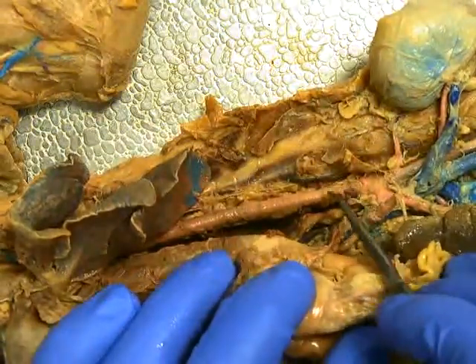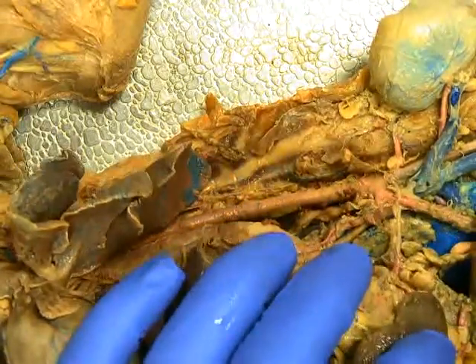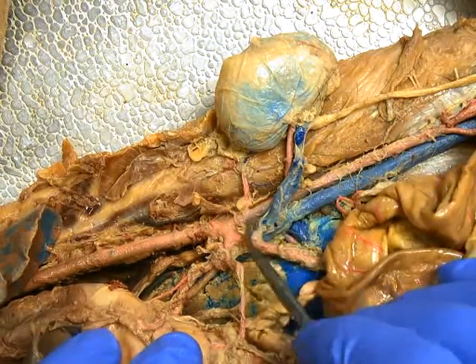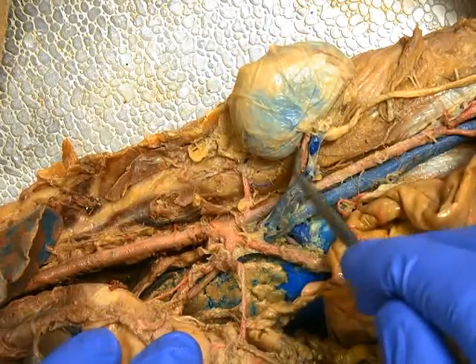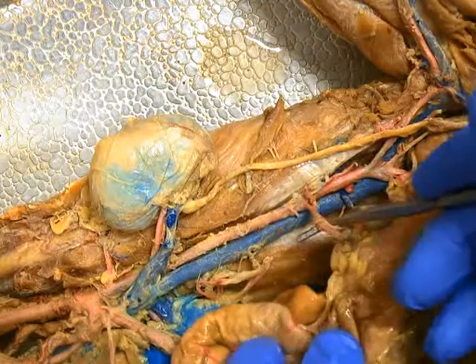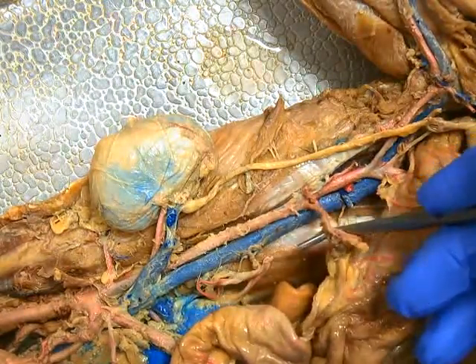All of this down here — the first branch coming off, you'll see the splenic artery, and then this branch going right into the mesentery is the superior mesenteric artery. The abdominal aorta continues; the next branch off would be the left renal artery going to the kidney, and the right renal artery on the other side. Continuing down the abdominal aorta, we'll see another small branch going up to the mesentery with the intestines — that would be the inferior mesenteric artery.